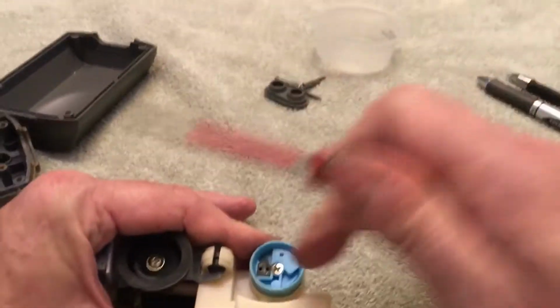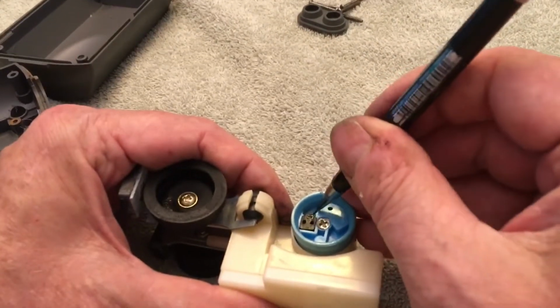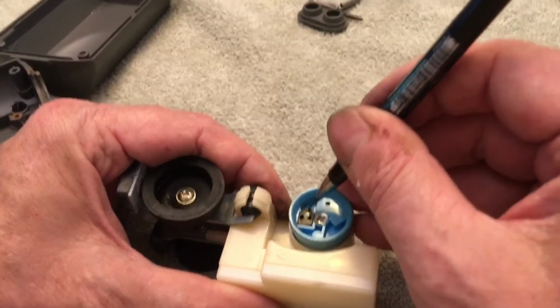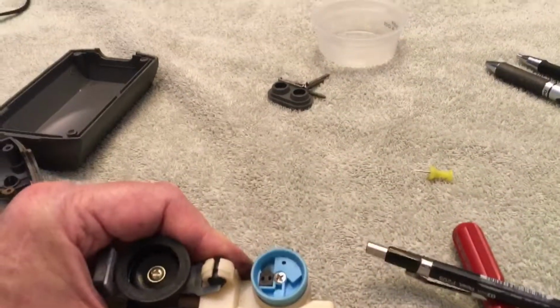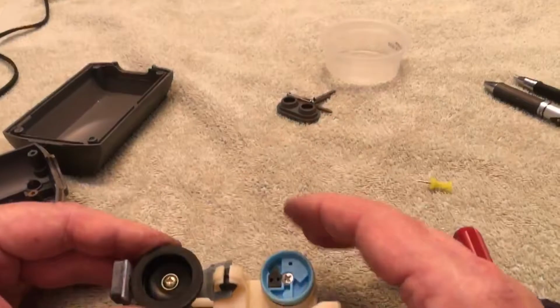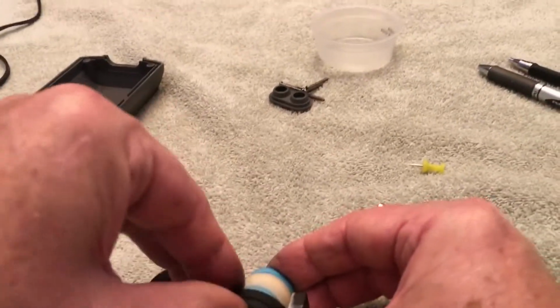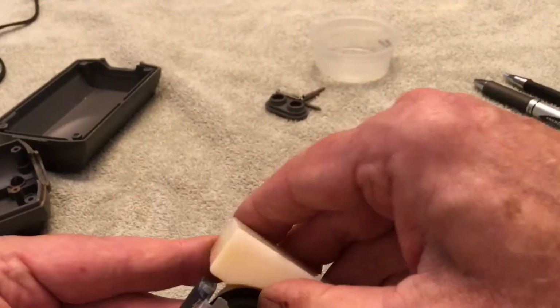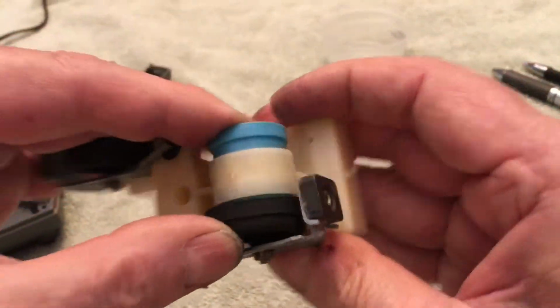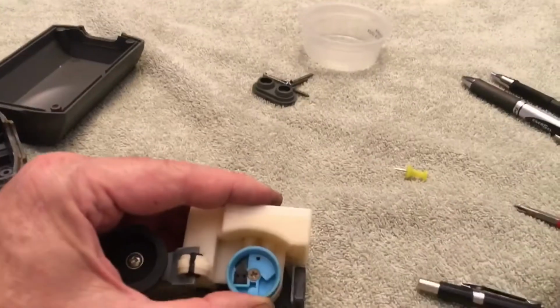So what we've done is reverse the valves. These are actually the valves. There's a thin piece of plastic here that flips open and closed. It flaps. It's a flap valve, just like on a 2-cycle engine. Now we just reassemble and do the other side. Make sure you get the rubber cup firmly sealed. I've actually done the other side, but I'll open it up to show you.